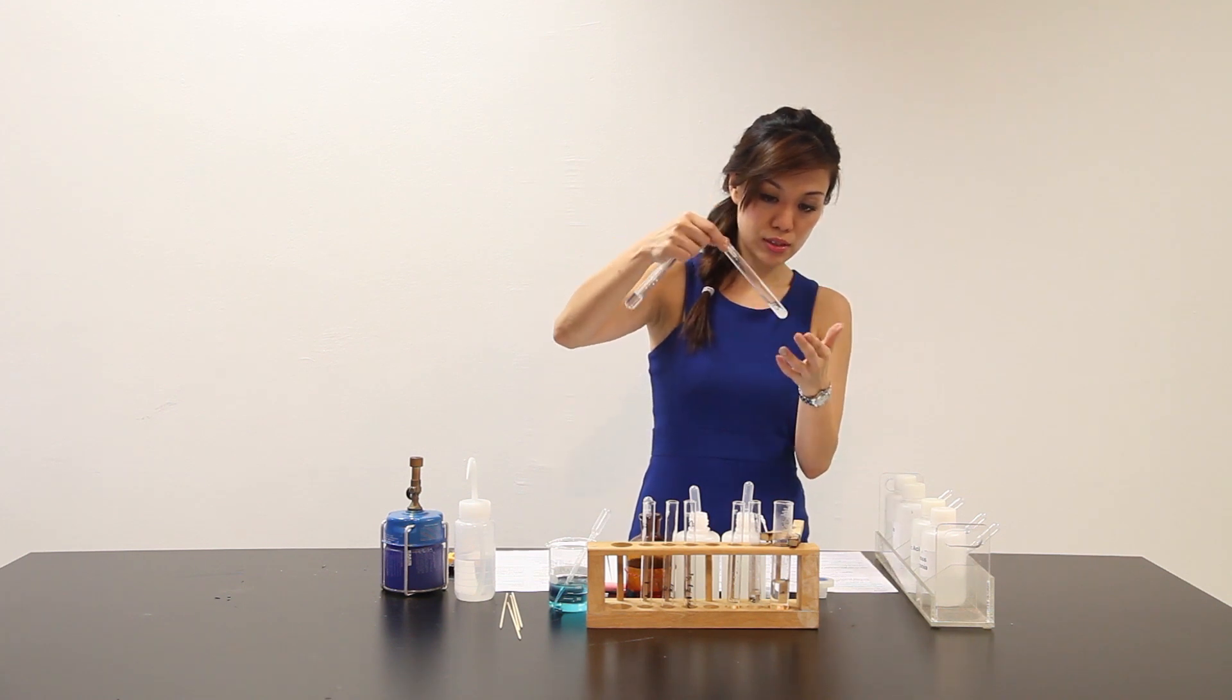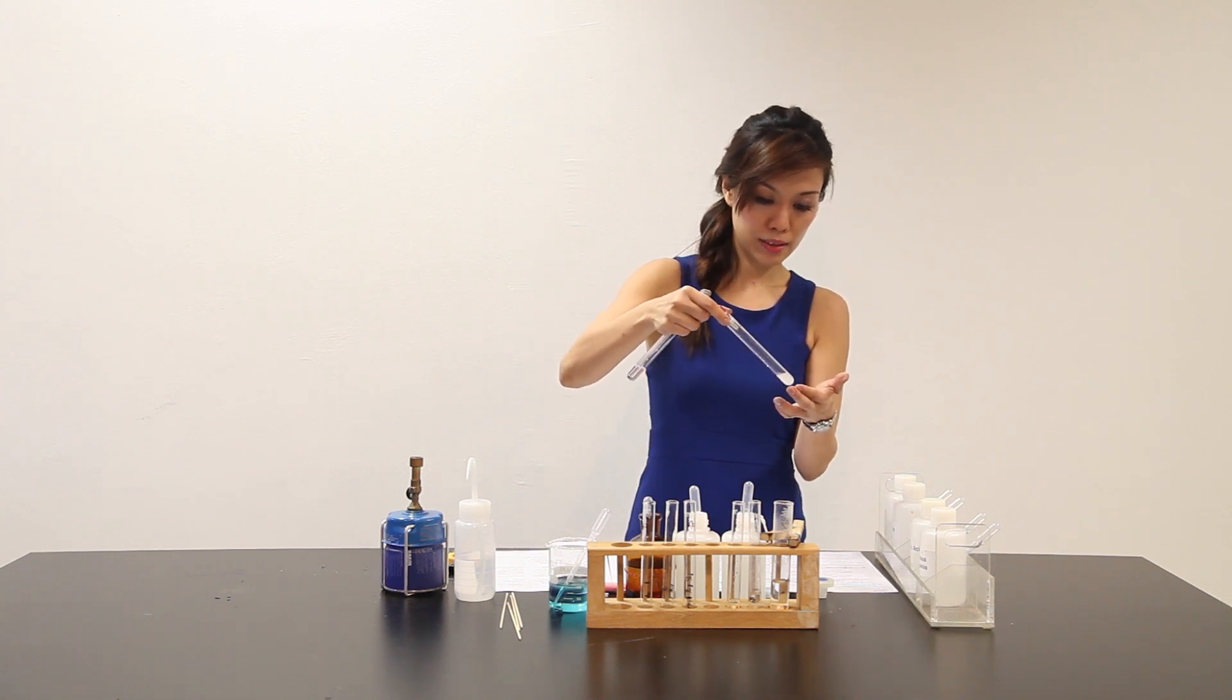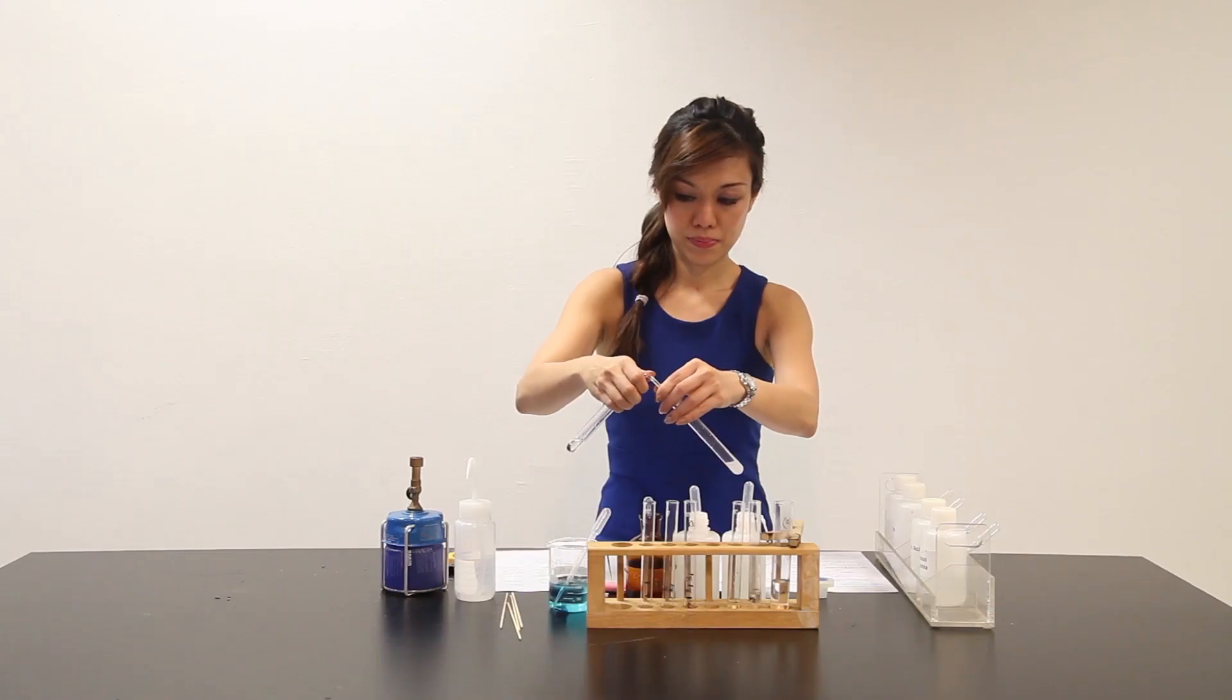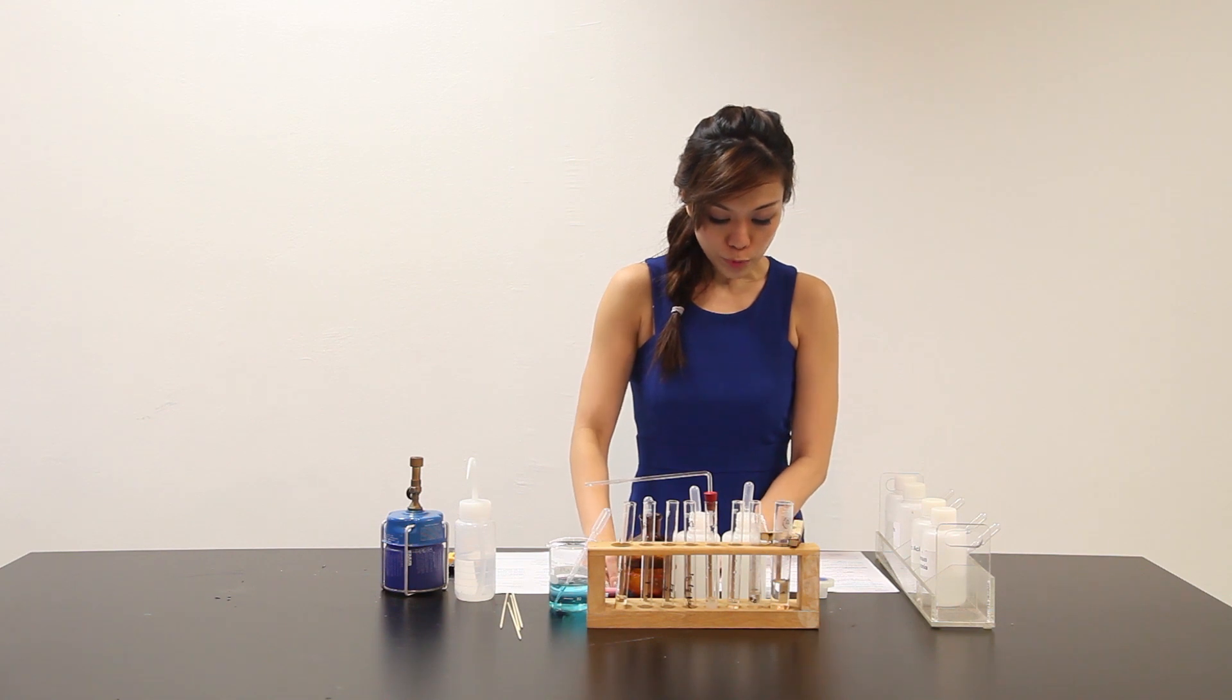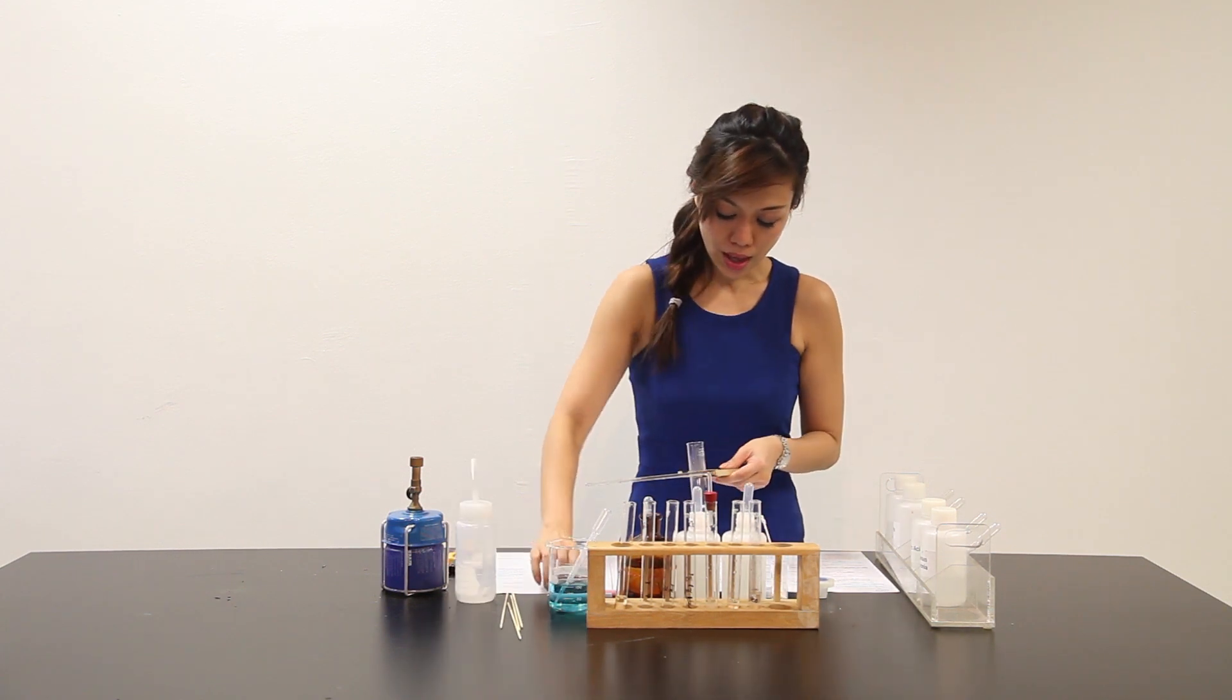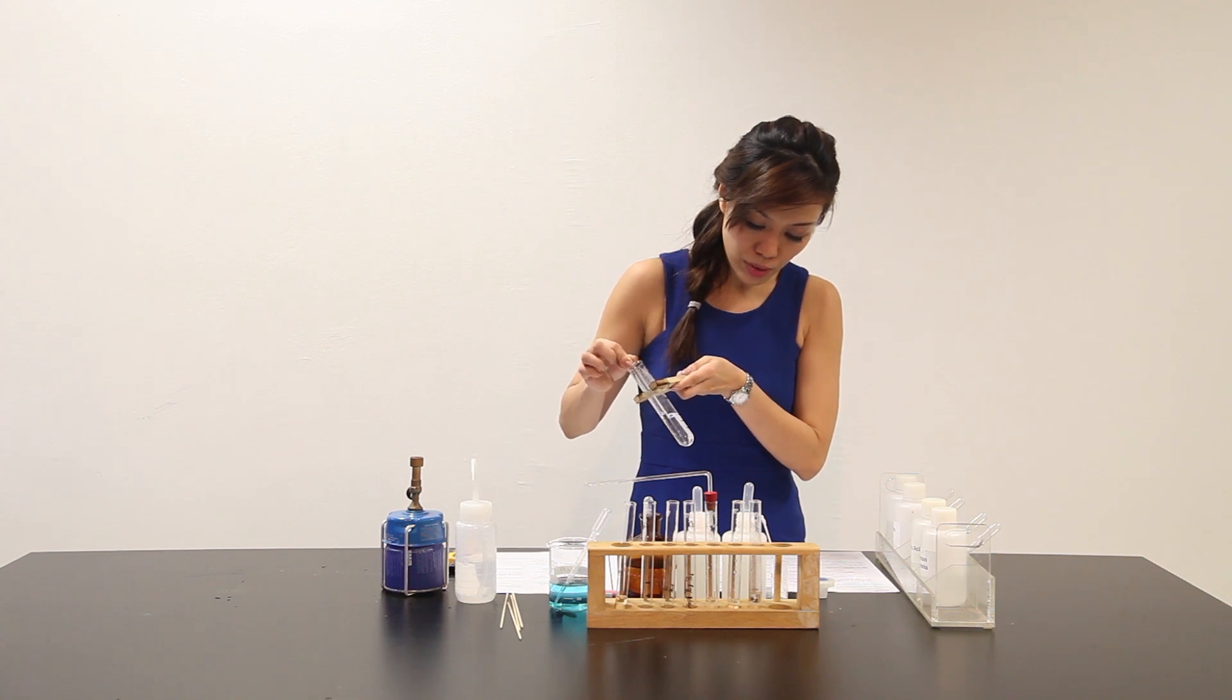Solid X is still dissolving in HCl, giving a clear solution. Let's move on to part D. Part D says that to the cold hard glass test tube from part A, add about 2 to 3 cm3 of the distilled water. Then, let me add the distilled water to it. And with stirring until all the residue is dissolved.